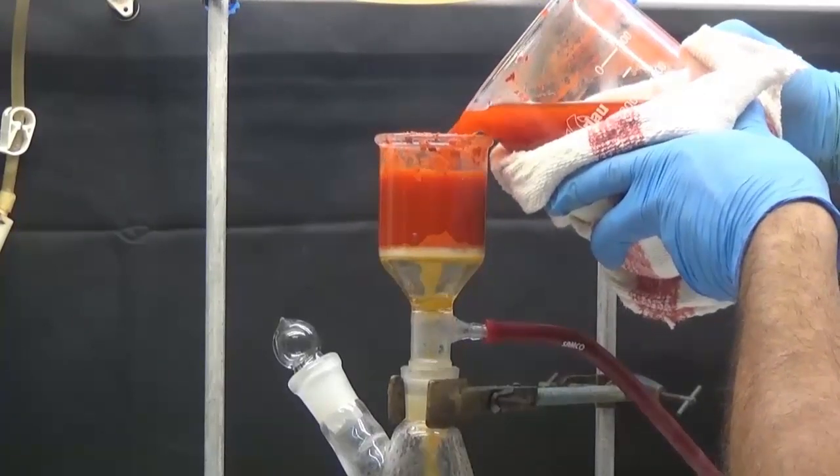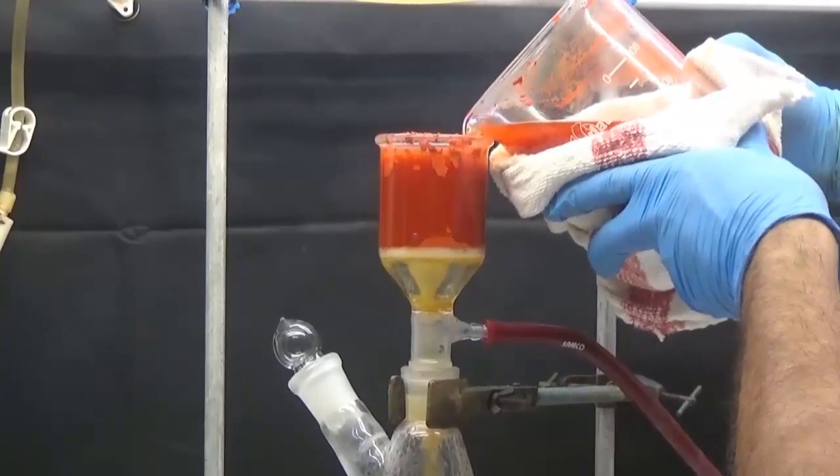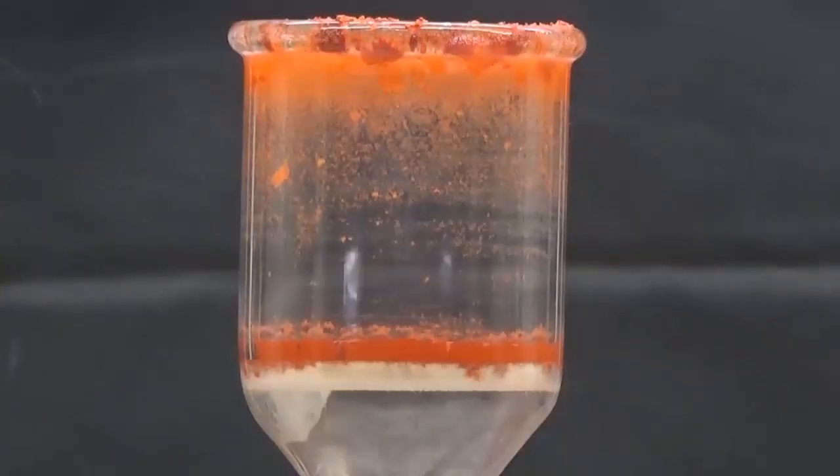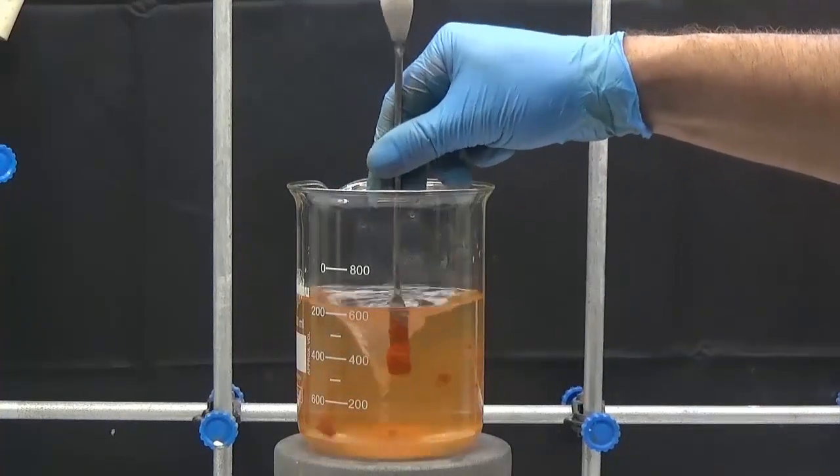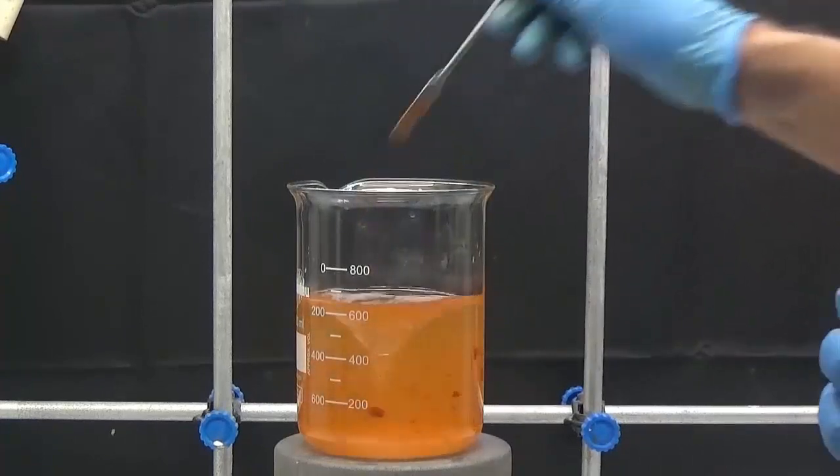A small amount of product is produced. The quantity of product obtained is lower than its predecessor, as the non-reactive phthalic anhydride was removed. The solid is then dispersed in 600 milliliters of boiling water.